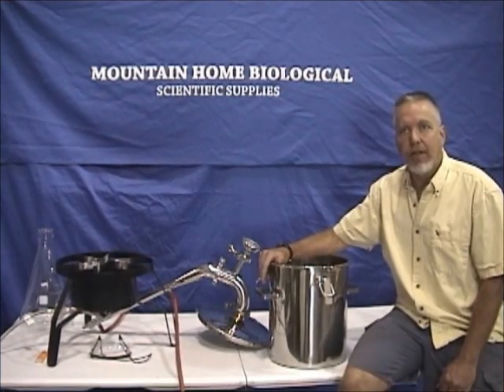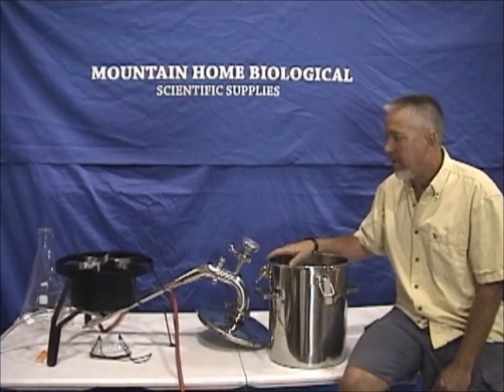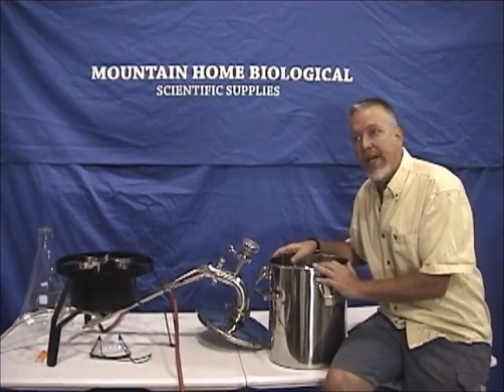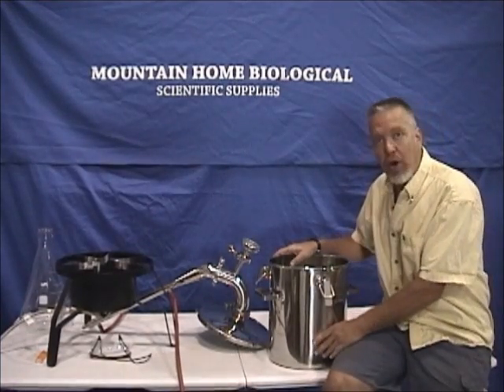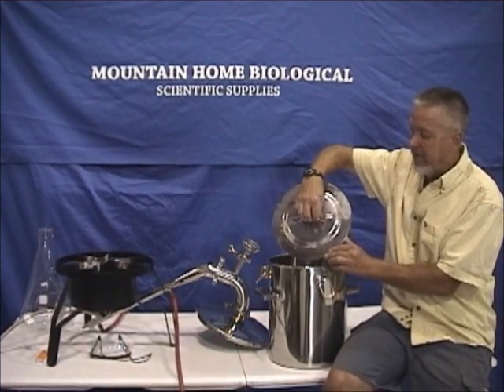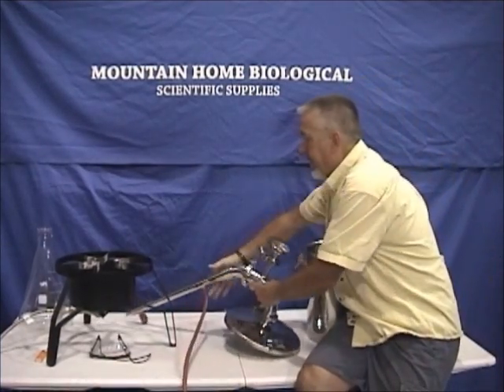I'm Biological and we're going to do a little video of how to distill lavender oil. We're going to be using our stainless steel distiller — it's 20 liters and you can find those on pelletlab.com. We have everything pretty much set up and I'll go through the basics of distillation. What happens is we're going to boil water, which creates steam, and the steam is then going to pass through this basket that sits in there, with the lavender sitting on top.